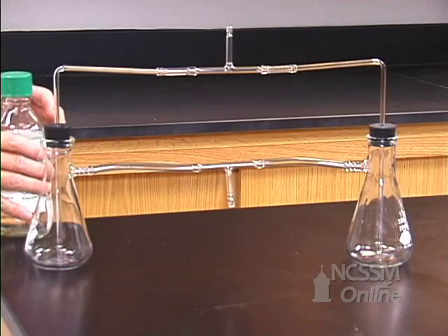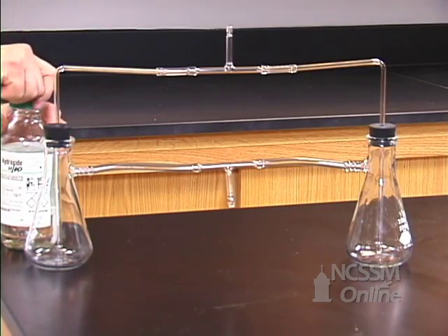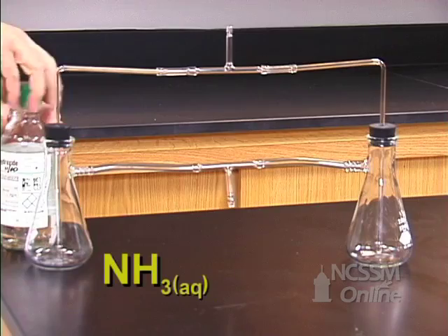I'm going to add some concentrated aqueous ammonia to one of the flasks.